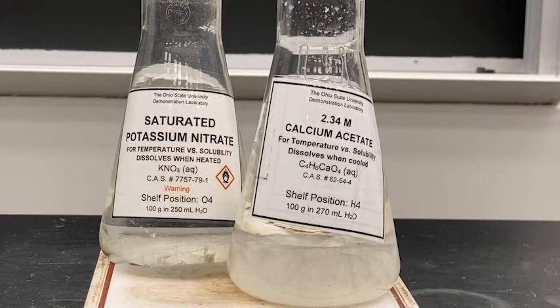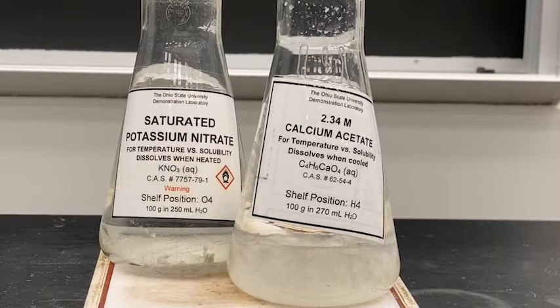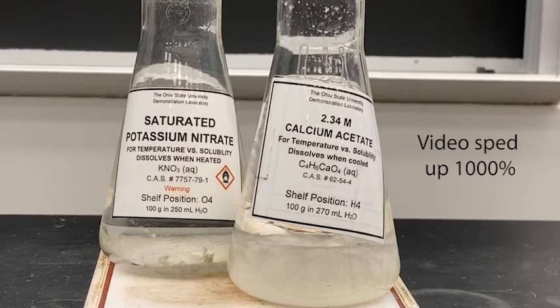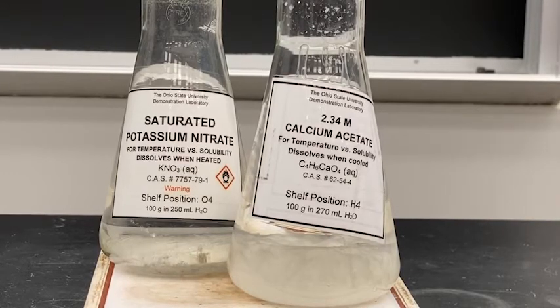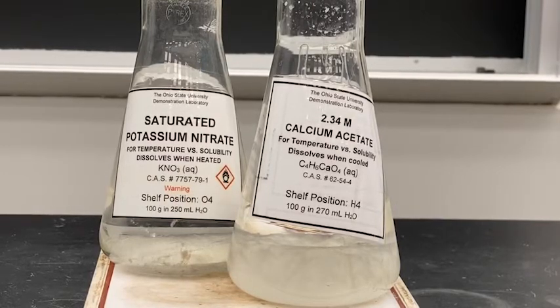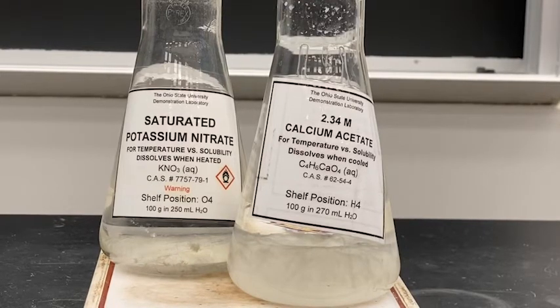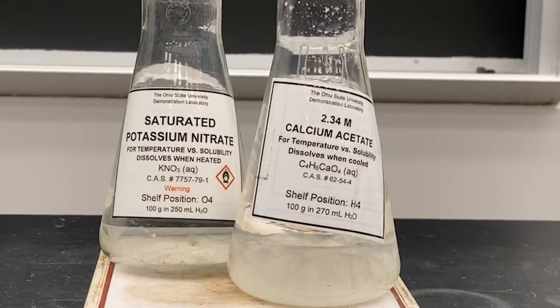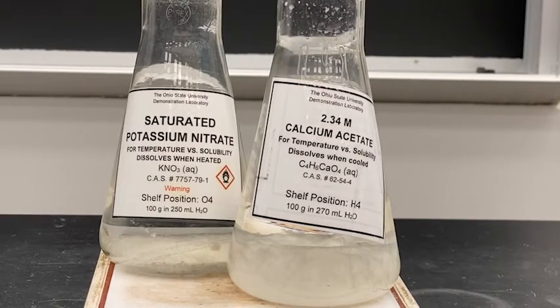Here we have a flask of potassium nitrate and a flask of calcium acetate. At room temperature, these are both saturated solutions. Let's heat them and see what happens. At a higher temperature, the potassium nitrate dissolves more and the solution becomes clear, while the calcium acetate dissolves less and starts to come out of solution.